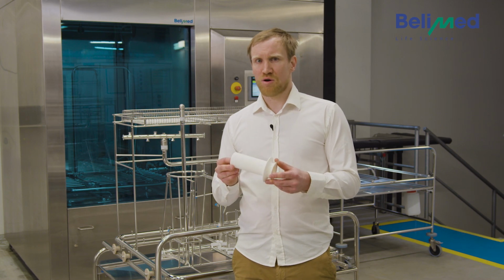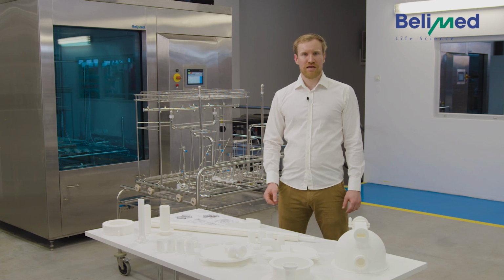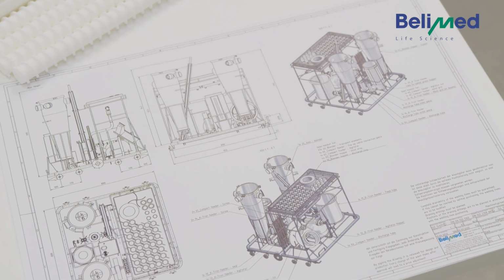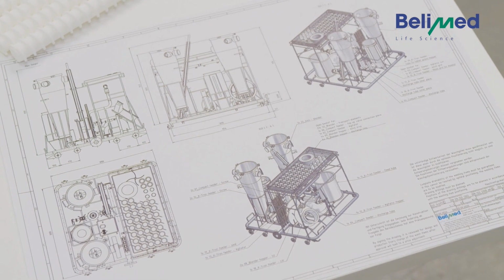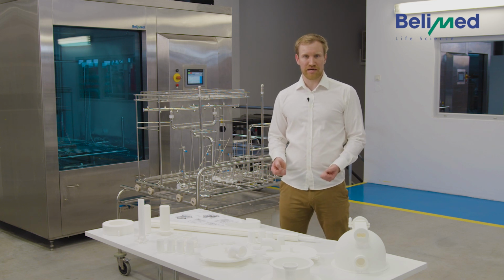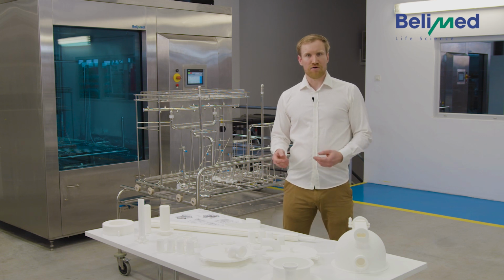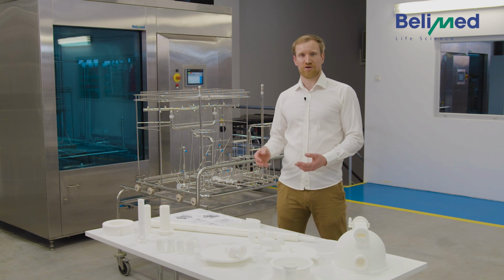But how do you know where to place the wash good? Currently, our customers use a loading scheme which we provide with every rack to load a rack correctly. This document is provided as a PDF and in the form of paper. On this loading scheme, it's shown where which wash good needs to be placed. For a person who does the loading every day, the loading scheme is not important anymore because they are so used to the process. But when there are new employees or a new person needs to get trained for the job, this loading scheme is still the master document.